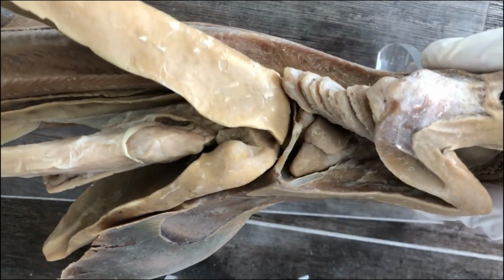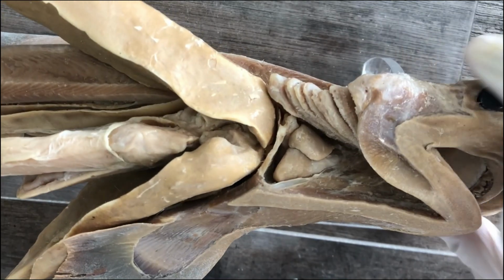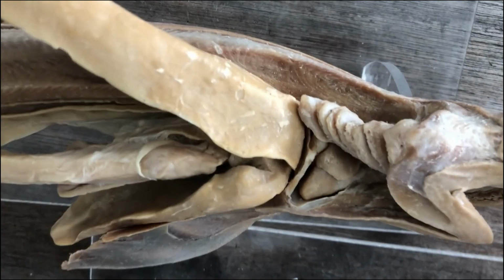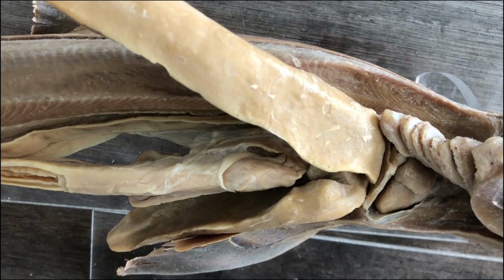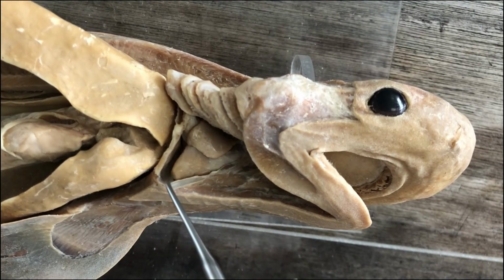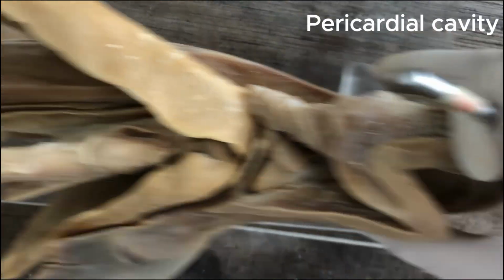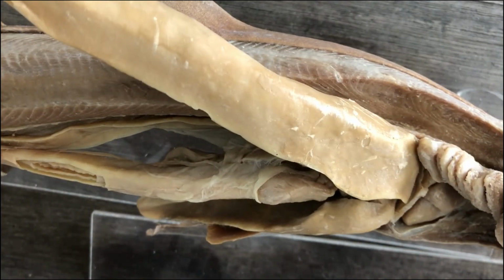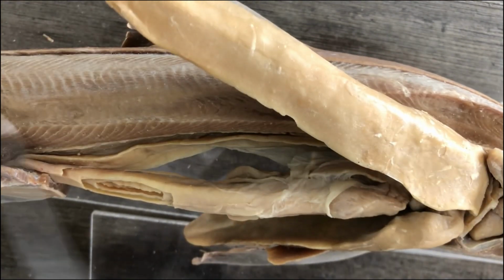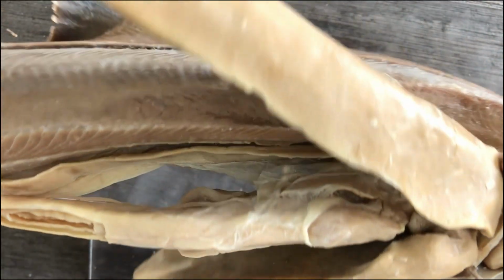Today we're just going to run through the visceral organs contained inside the coelomic cavities of the shark. Right? So the coelomic cavity of the shark has been divided into two compartments. The anterior compartment of the coelom contains the heart, and that's the pericardial cavity. Whereas the more posterior and larger compartment of the coelom is called the pleuroperitoneal cavity, containing most of the visceral organs.